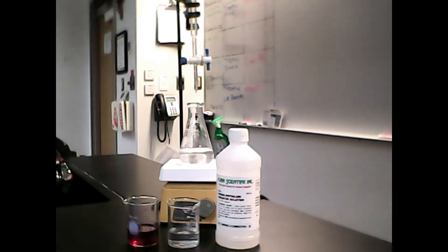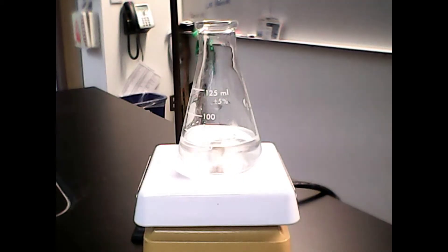You kind of see at a glance what's involved, but I'll take you through it step by step and show you exactly what we're going to use and how we use it. The first thing that we need is a magnetic stirrer. You see in this small flask we have a solution being stirred by a magnetic stir bar. This is so we don't have to waste time stirring it ourselves, and on top of that, it keeps the solutions constantly mixed.